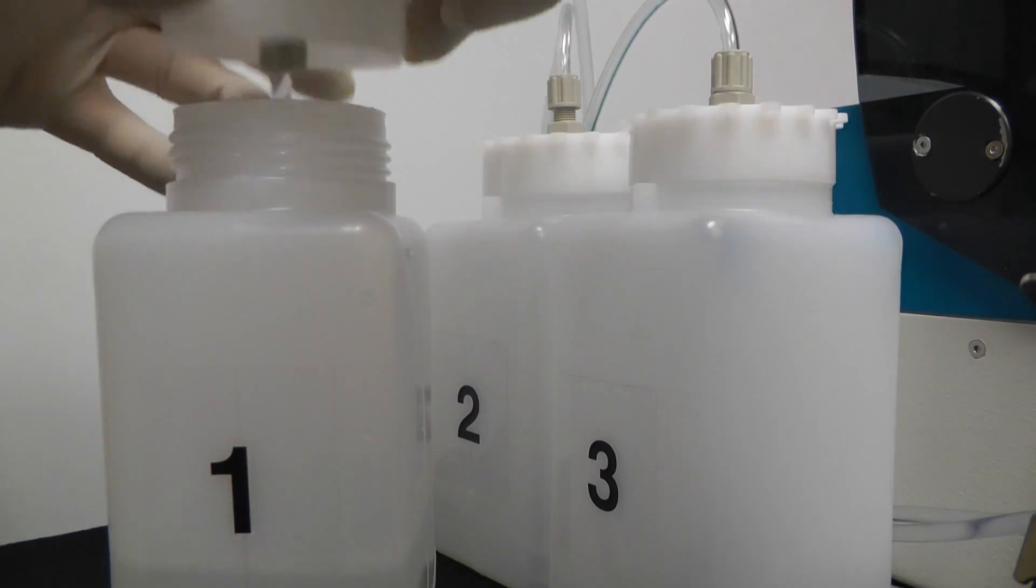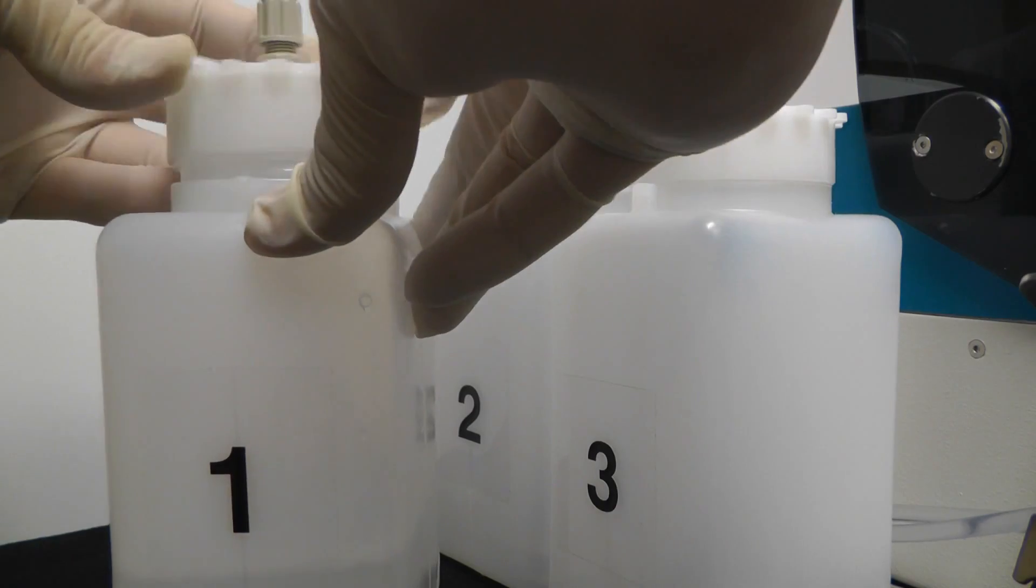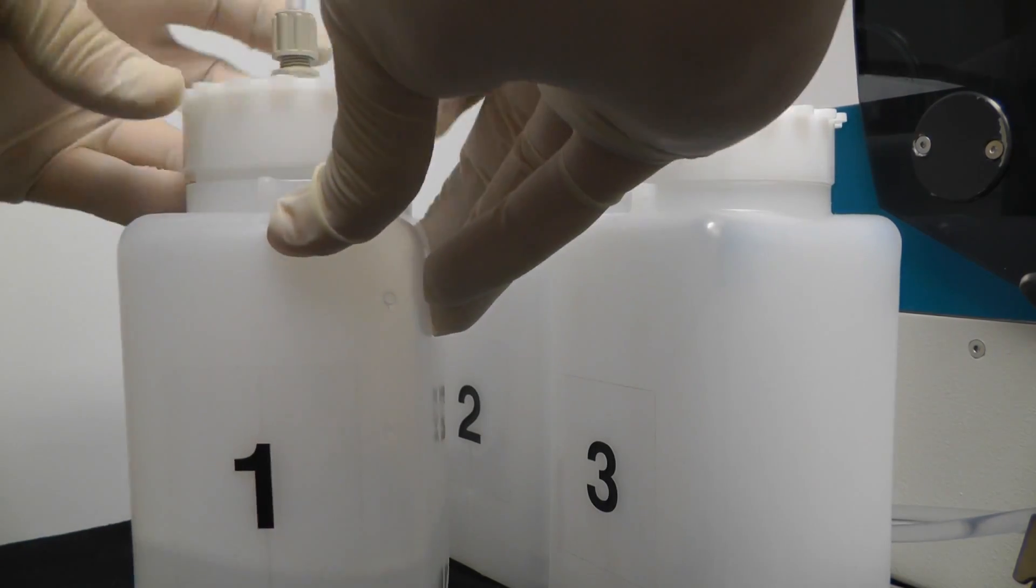Up to three wash buffers can be used with the Crocodile Mini Workstation. Here we are adding the one wash buffer needed for this assay.